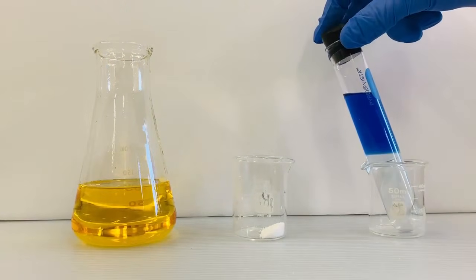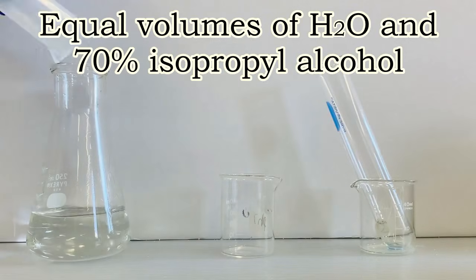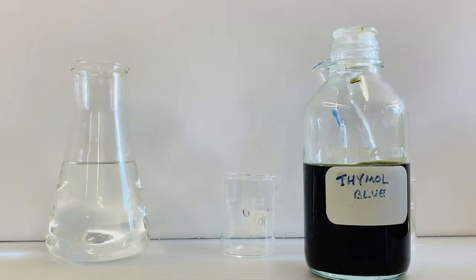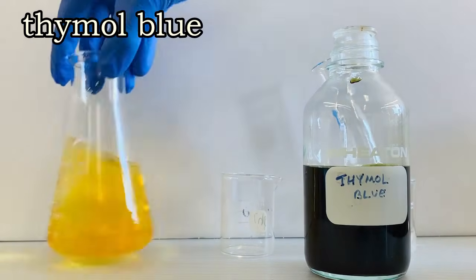How does this experiment work? Well, the yellow fluid is made by mixing equal volumes of water and 70% isopropyl alcohol. An acid base indicator called thymol blue is added to the mixture and this gives the fluid a yellow color.